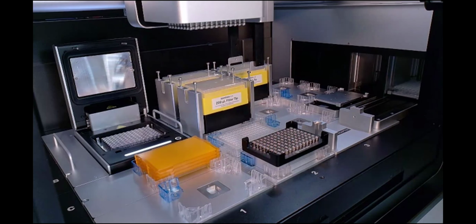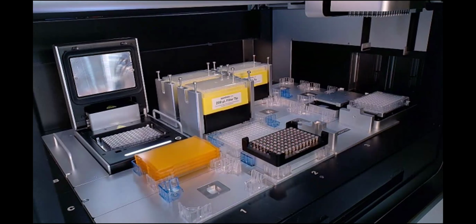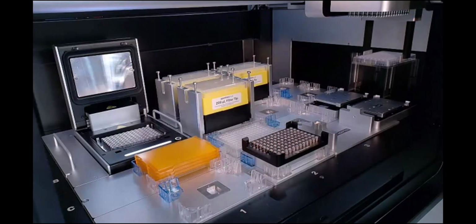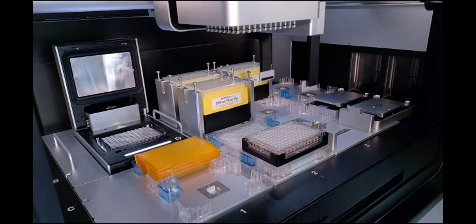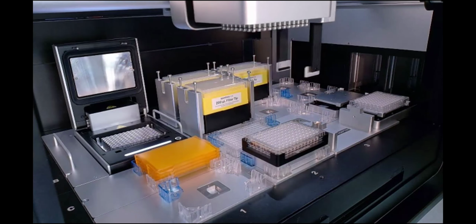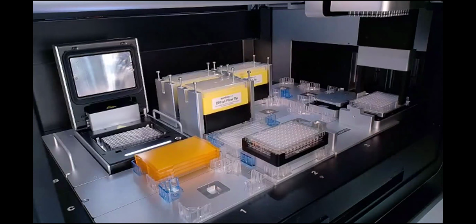Next, we're also going to drop off a plate at the magnetic module and then at the thermocycler. And then in this demo protocol, we'll actually cycle to have the same end state as it started at. And so you'll see all of these materials actually also returned to the stackers. So they have the ability to both retrieve and also store labware within them. As Matt had mentioned, this is unidirectional, so there is no random access for these. So if you store a labware, it's a last in, first out situation here. So you might have to be strategic if you are hoping to maximize your space with that.